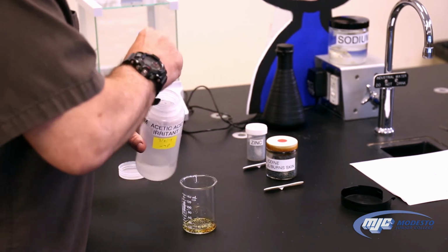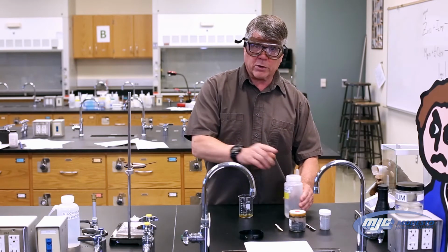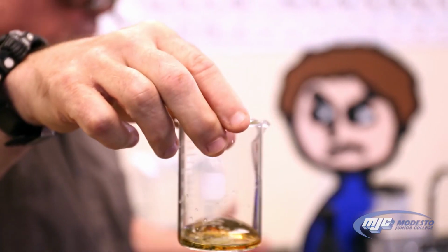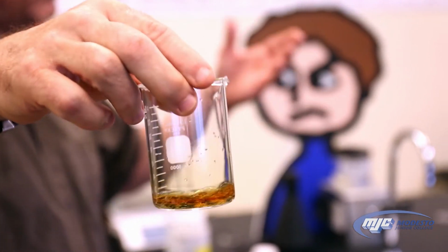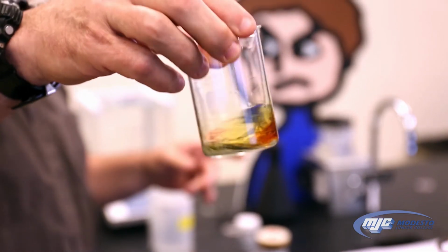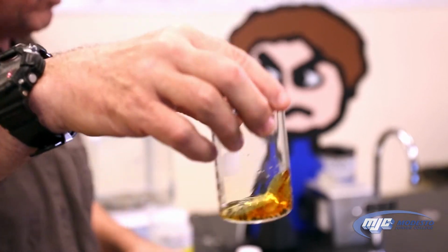All right, so now look at this real quick, and then we're going to get started on the second part of the experiment, the magnesium oxide synthesis, while this is reacting. If you look at that, it's going to get darker and darker as the iodine dissolves, and then as it starts reacting with the zinc, it's going to start getting lighter and lighter. We want to make sure it keeps reacting, allow it to react all the way until that solution on top is perfectly clear again.